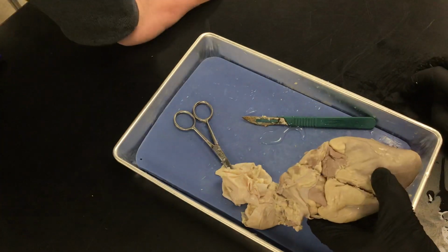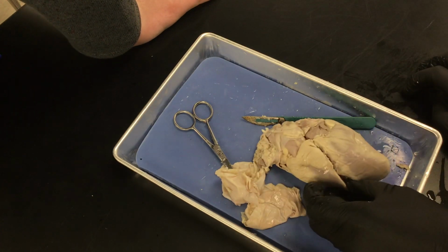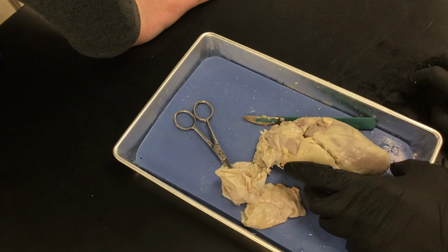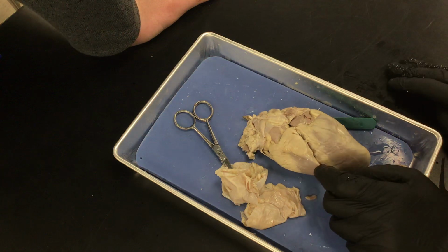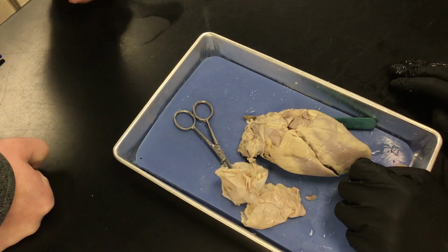Let's look at what it talks about next. What do you think the purpose of the coronary artery is, and what results if there's a blockage in this vessel? Oh, there it is. Remember arteries versus veins. Okay, so we can identify these later, but let's go ahead and go to the dissection part.